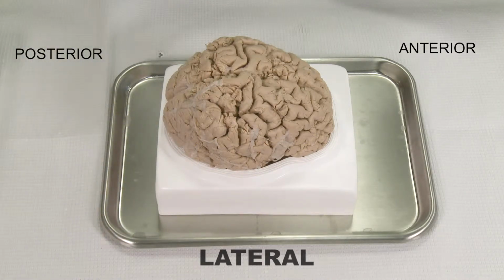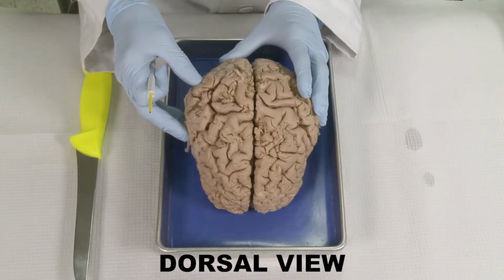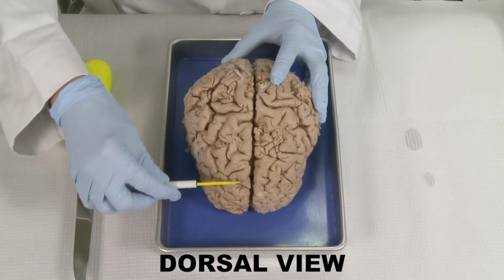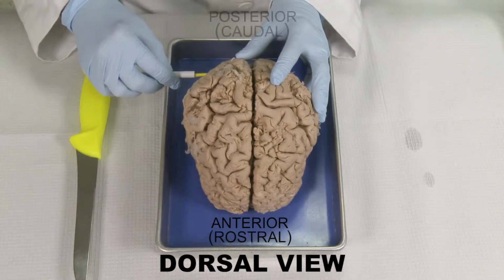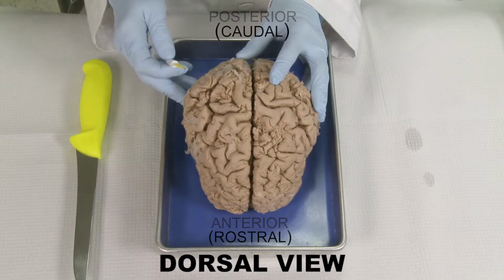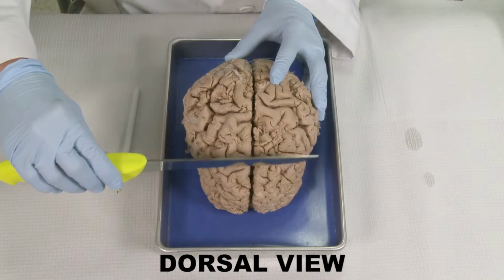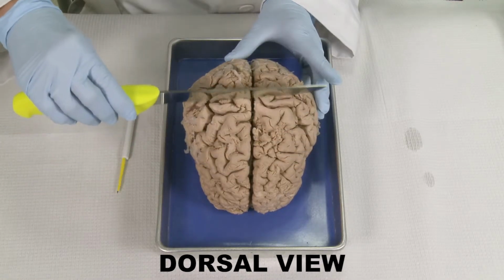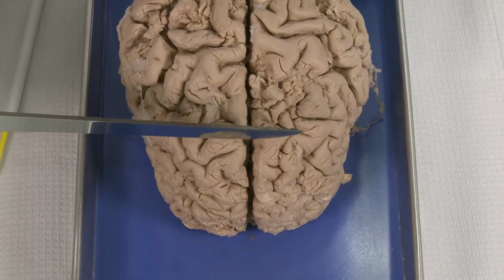Each section will be laid down on the tray, and we will point to the structures that are visible on each level. So now you're looking at the dorsal view of the brain. This is the anterior part of the brain, and this is the posterior part of the brain. We will cut with a sharp knife, starting from the rostral and progressing toward the caudal part. Let's make the first cut.